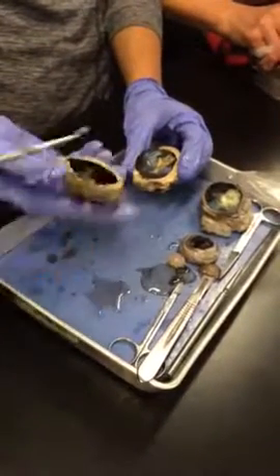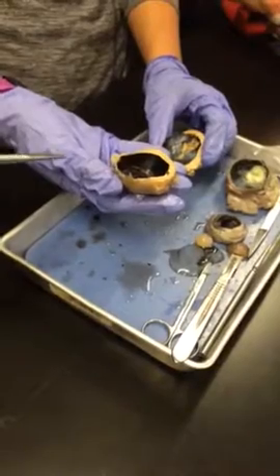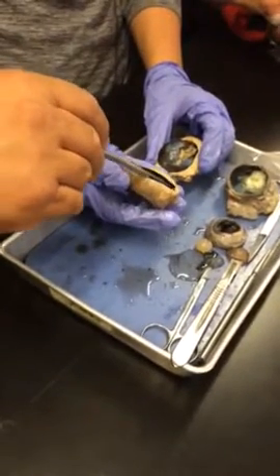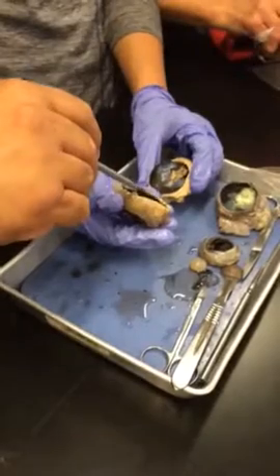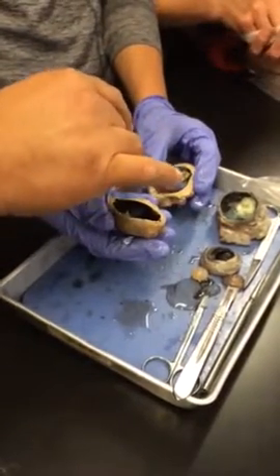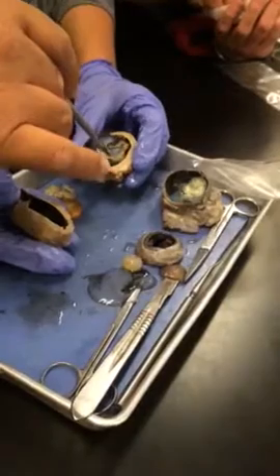Alright, so if we turn this guy around, the ridge-like structures here, what are these? Ciliary bodies. What tunic does that belong to? Vascular. The dark, thin membrane that you see here, what is that structure? Choroid, right? What tunic does that belong to? Vascular. Now here we do see this structure here, very thin, flimsy membrane. Kind of looks beige, right? Maybe more white. What is this tunic?